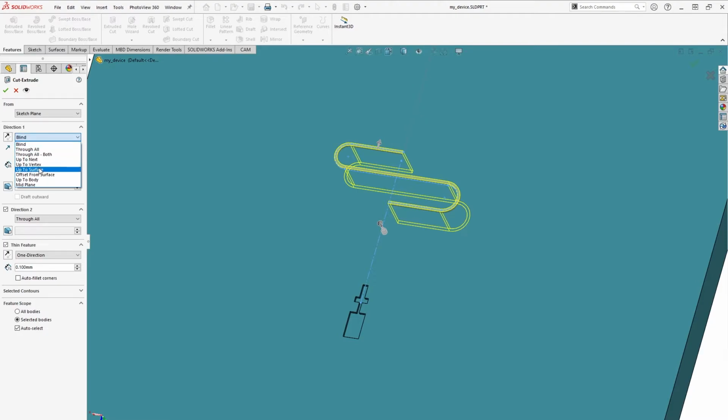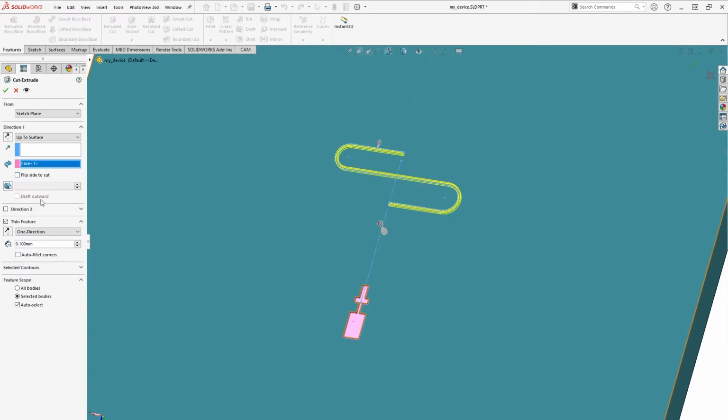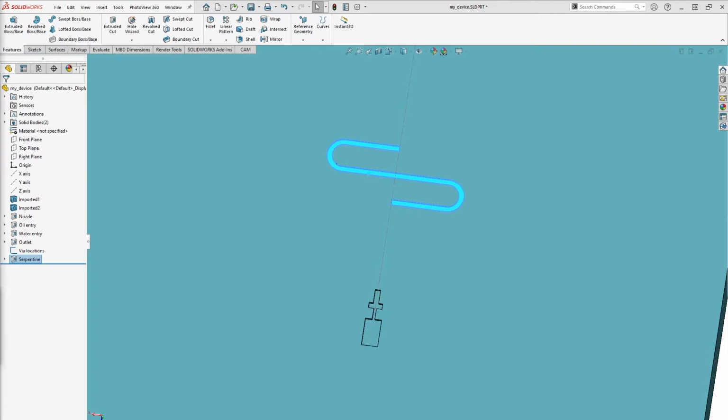You may have to toggle flip side to cut to get the feature to cut in the correct direction. Set the thickness to 200 microns and the type to midplane. Finally, hit the check mark and rename the feature to Serpentine. It's a bit of work to create and dimension serpentine features, so whenever possible, we want to use patterns to save us both time modeling and to help capture our design intent.